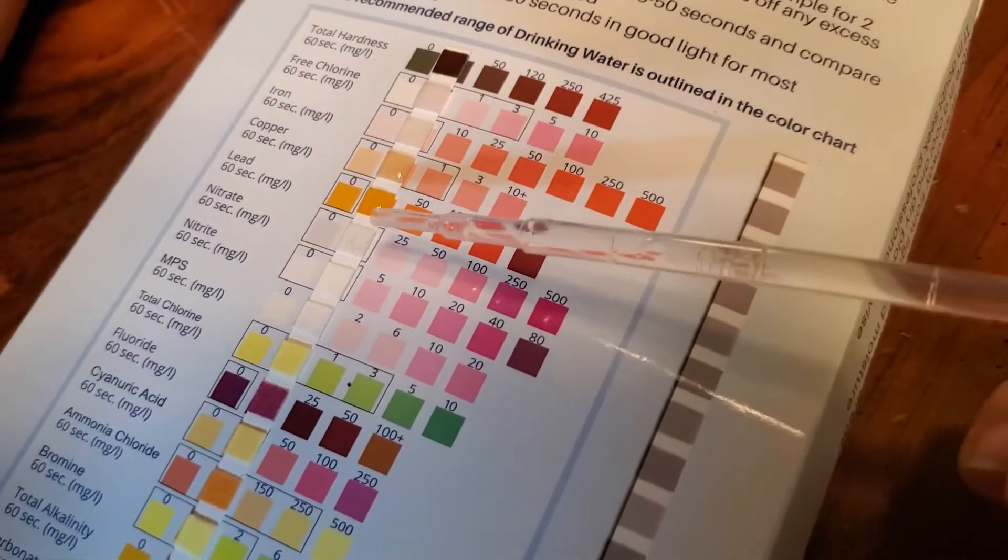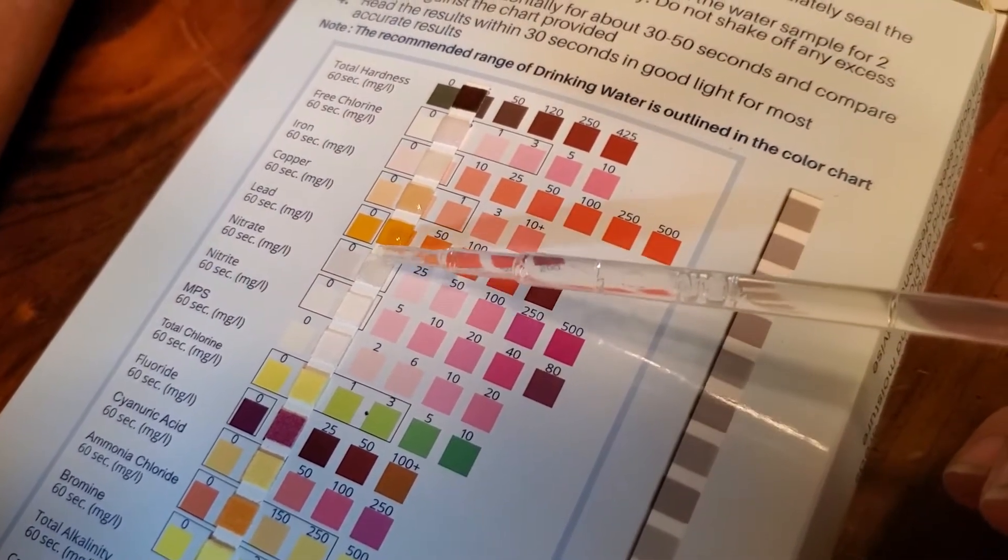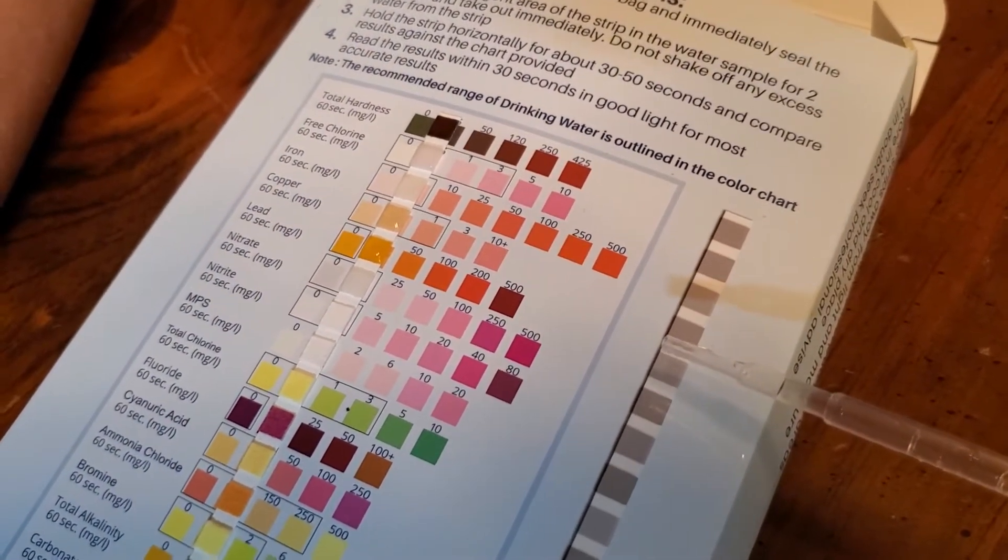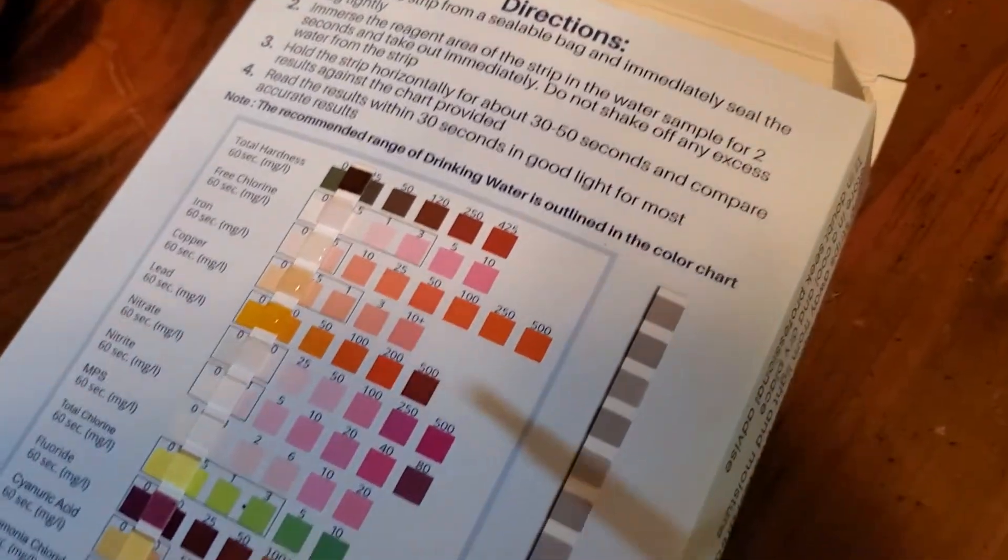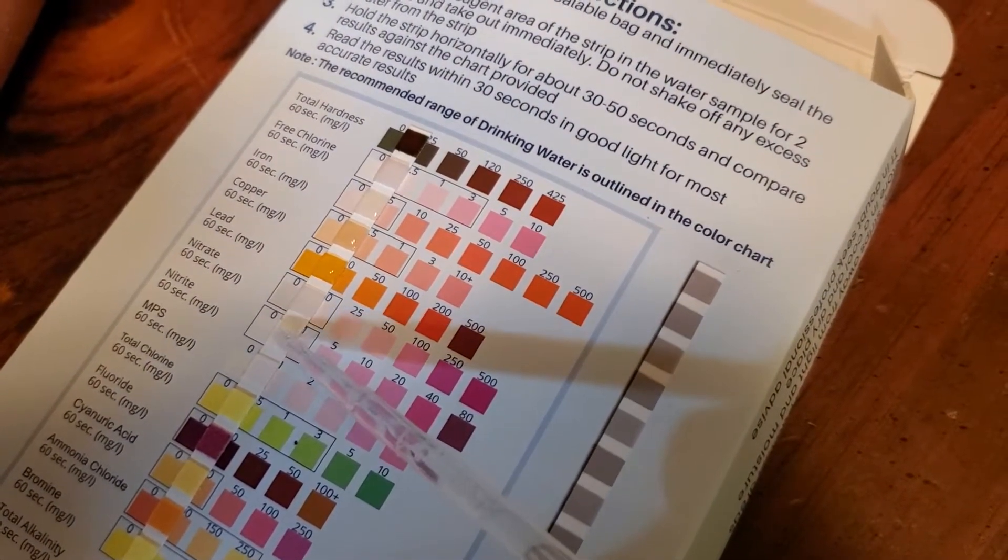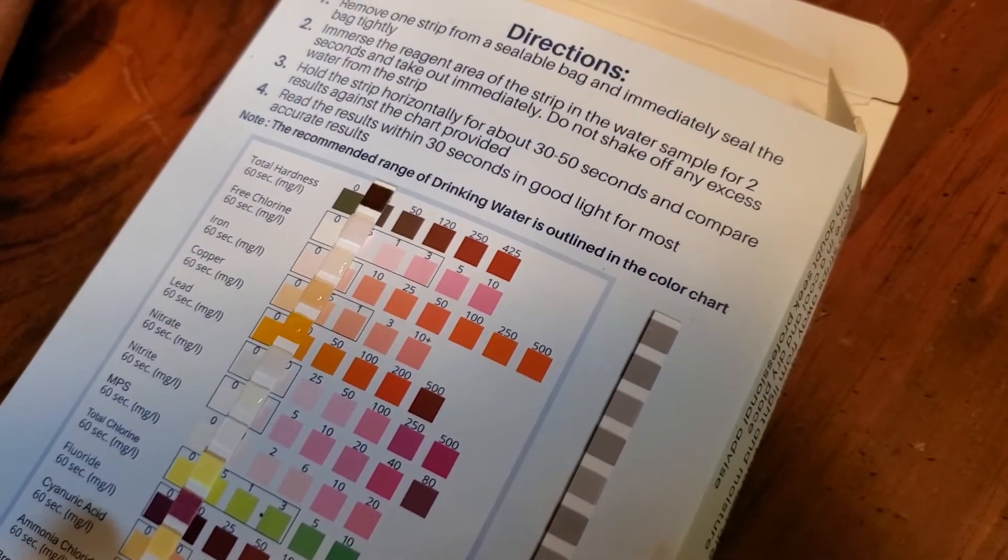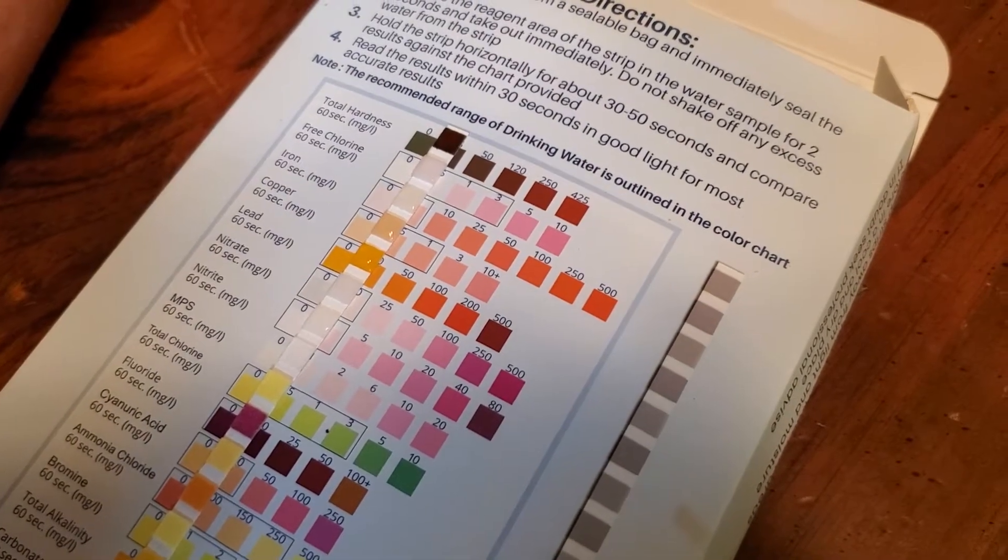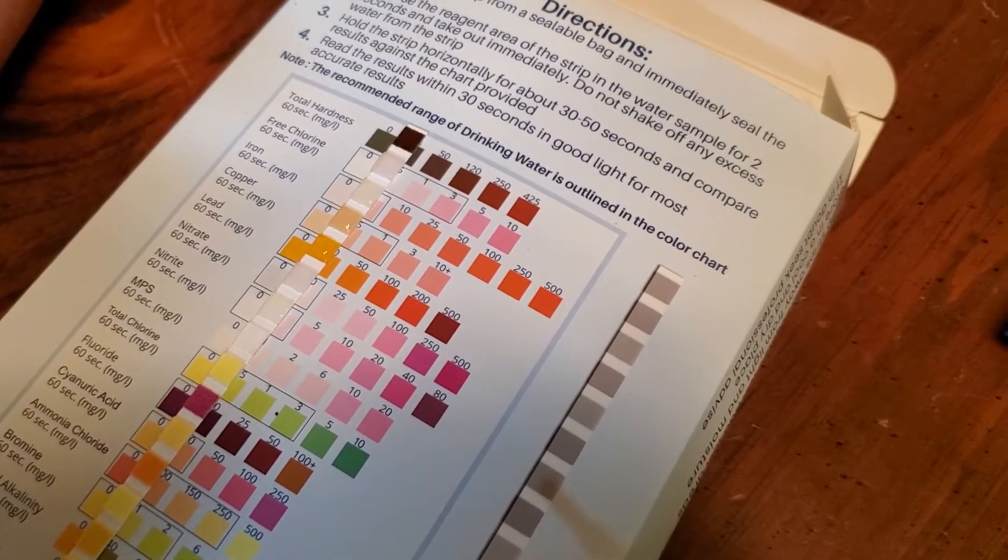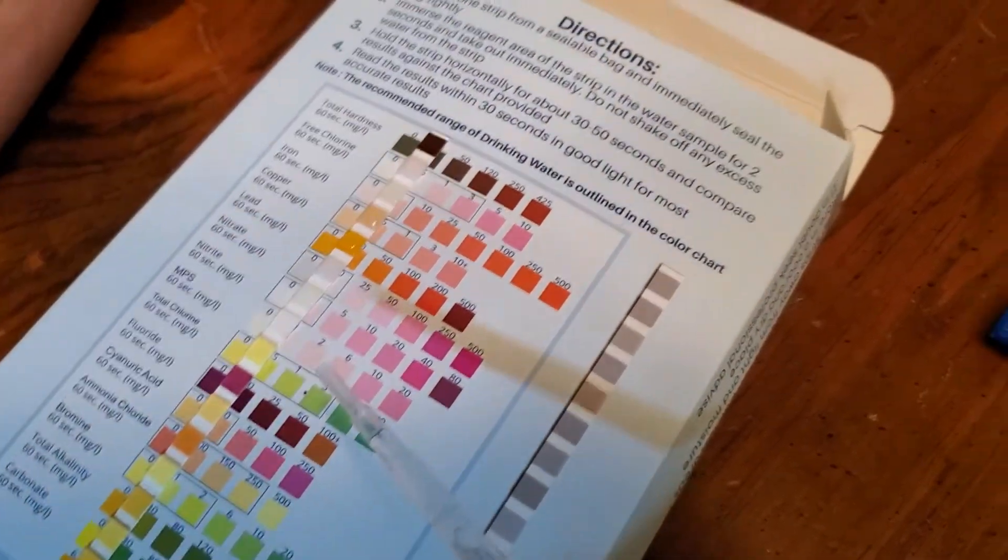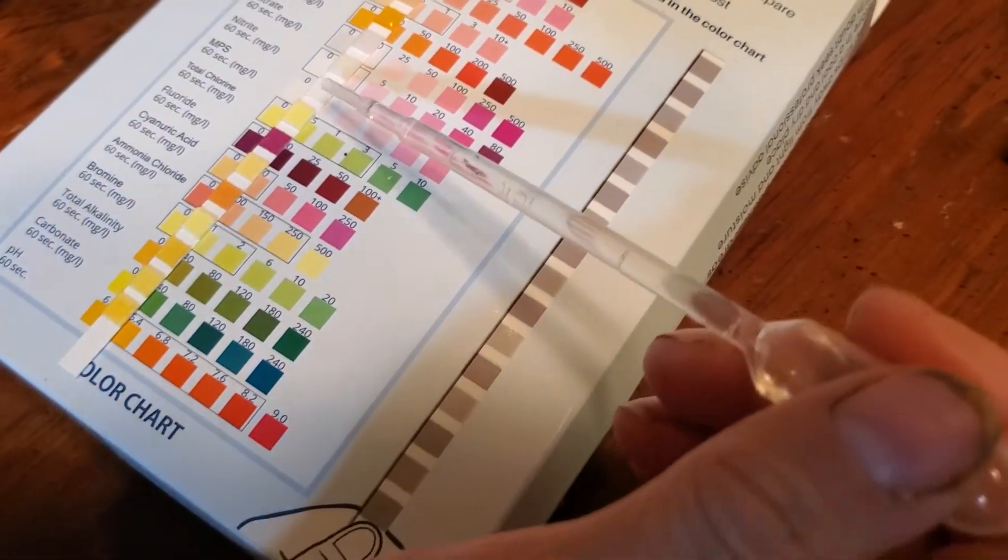Nitrate. It looks about zero. The lead one is really the one that bothers me. With lead you don't want too much lead in your water, you don't want any lead in your water. Too much lead can be bad for you, any lead is bad for you. Lead in cereal? No there's not, there is some, oh no it's iron isn't it. That's right. Lead is a poison. So is gold but people eat that. Yeah, people are stupid.